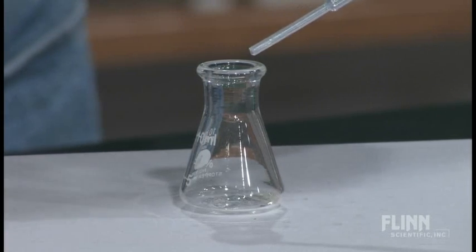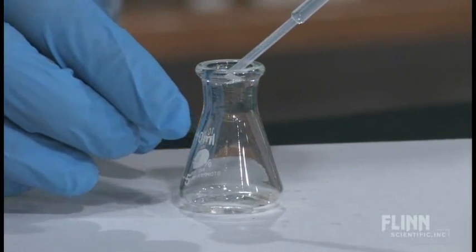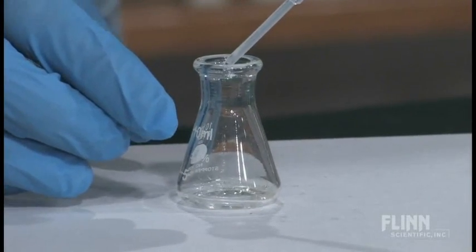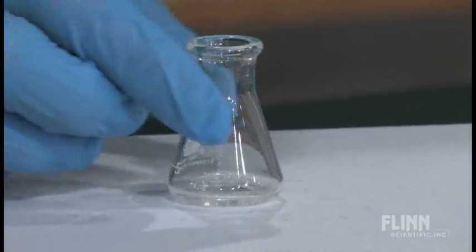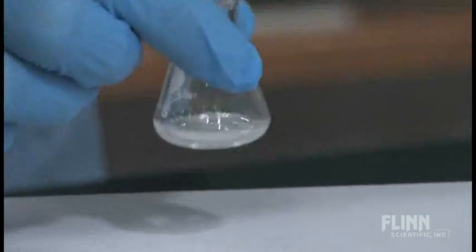This just turns out to be concentrated. I'm going to drop a few in, and I think hopefully you can see that there's some bubbling taking place. Ten, twelve drops will dissolve the amount that the instructions in the experiment tell you to use. Maybe a little more than that. This time I've just dumped in some extra.